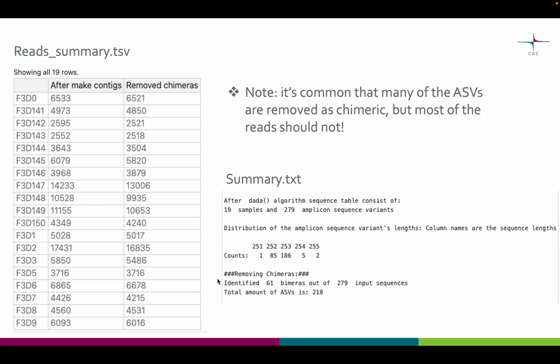Like in this example, we found 61 ASVs to be chimeric from the 279 input sequences, or ASVs. But like you can notice from this table on the left side, not many reads were removed after all, just a few. The most important thing is that we kept most of our reads. If you notice that most of your reads are removed, please double check that you managed to remove the primers from the reads. Especially primer sequences with ambiguous nucleotides can cause that to happen. I have seen examples where over 90% of the different unique ASVs are removed in this step. But especially if most of the reads still remained, that should be okay. And you can consider your own data and think how many different ASVs you are expecting in the samples.